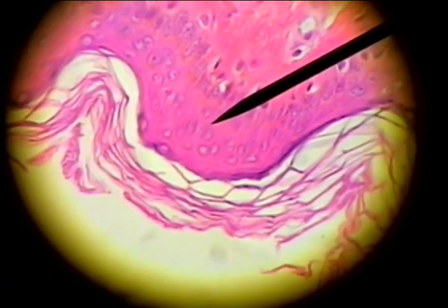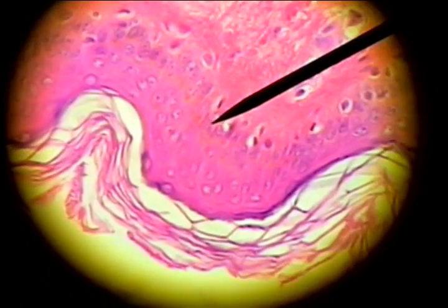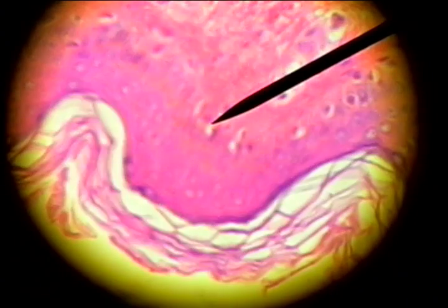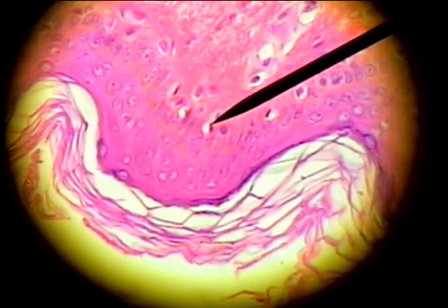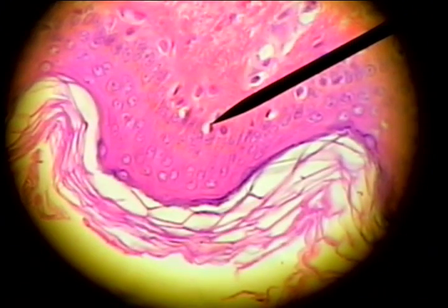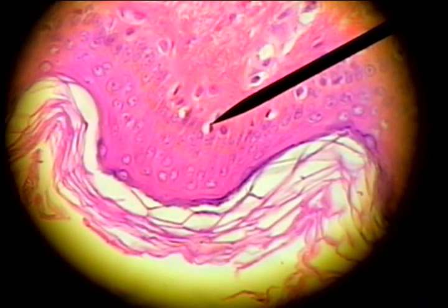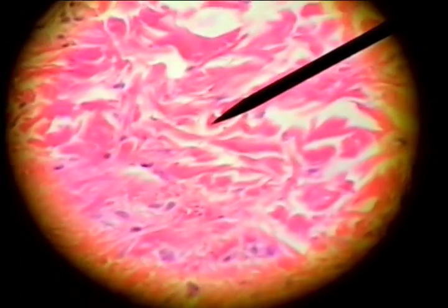Then down here is the stratum basale, or stratum germinativum — the first layer of the epidermis. In between the stratum basale cells we see these clear cells, or white cells, and they are either melanocytes that make the pigment, or Merkel cells that are mechanoreceptors for nervous sensory input through the skin.